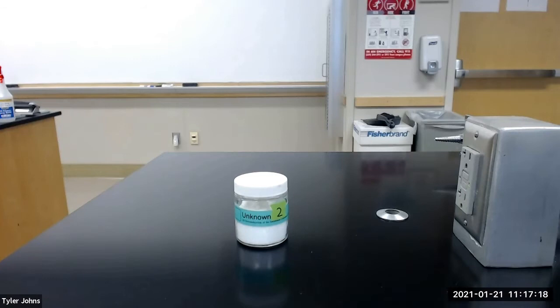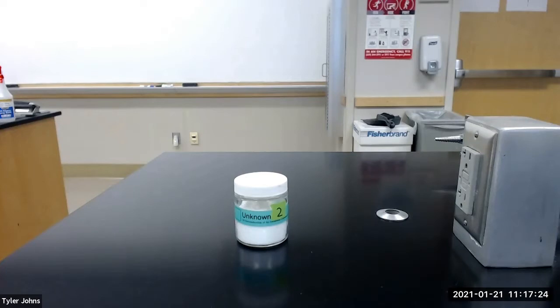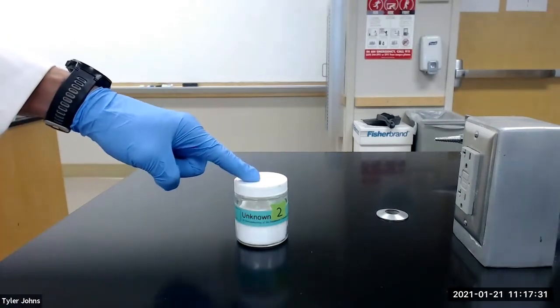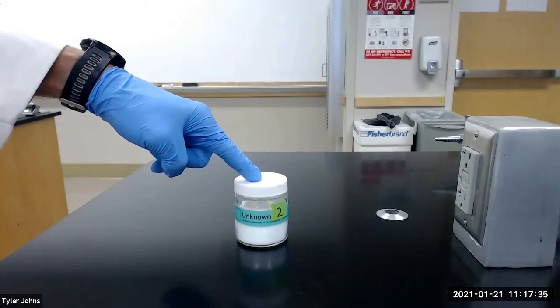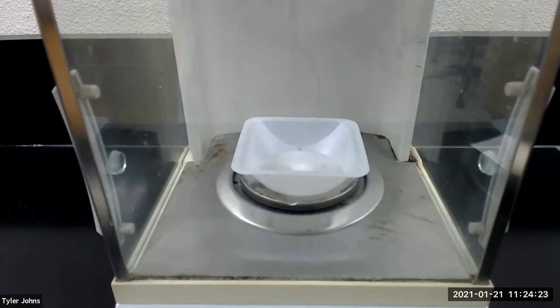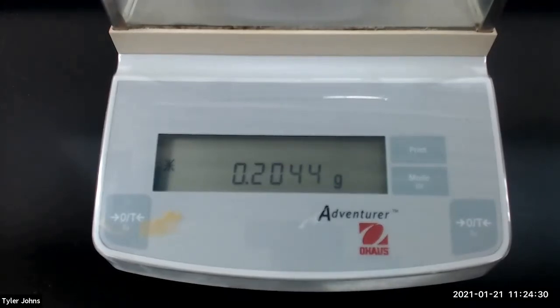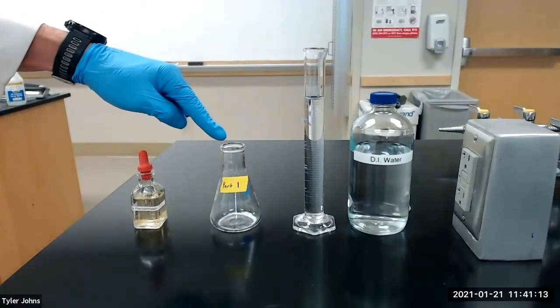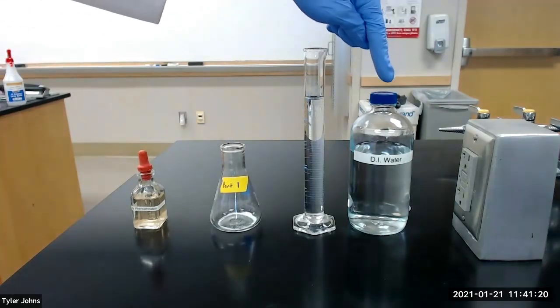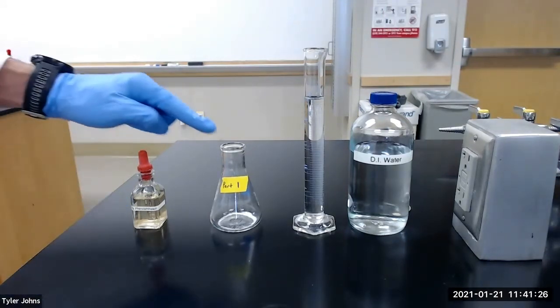For part one of this experiment, we will determine the appropriate sample size of unknown acid to use. The appropriate sample size will require approximately 25 milliliters of standard base for titration. We will be using unknown acid number two, and we will measure out approximately 0.2 grams. The mass of unknown acid number two that we will be using is 0.2044 grams. I've added it to an Erlenmeyer flask and will next dissolve the acid using approximately 50 milliliters of deionized water. We will also add three drops of 1% phenolphthalein indicator.